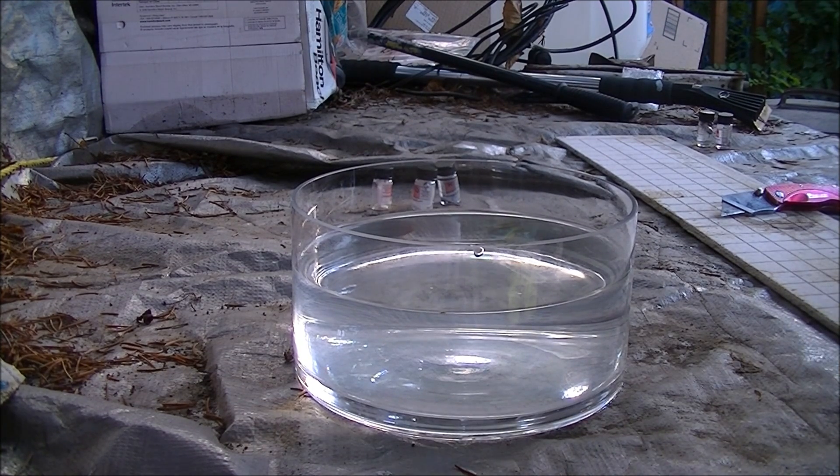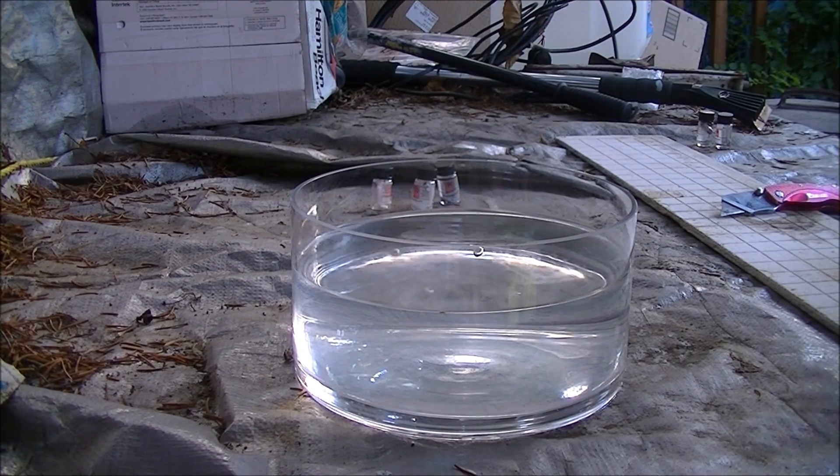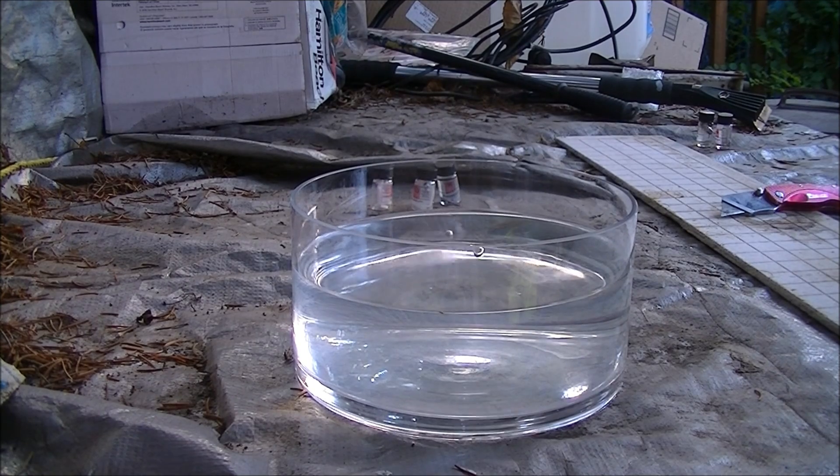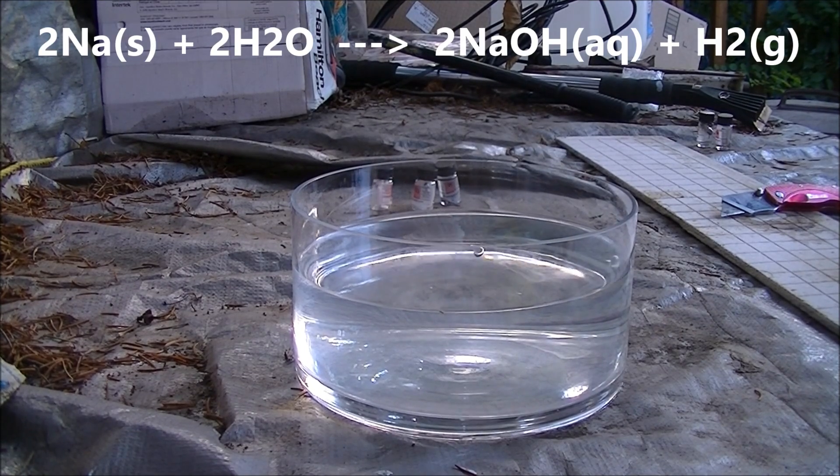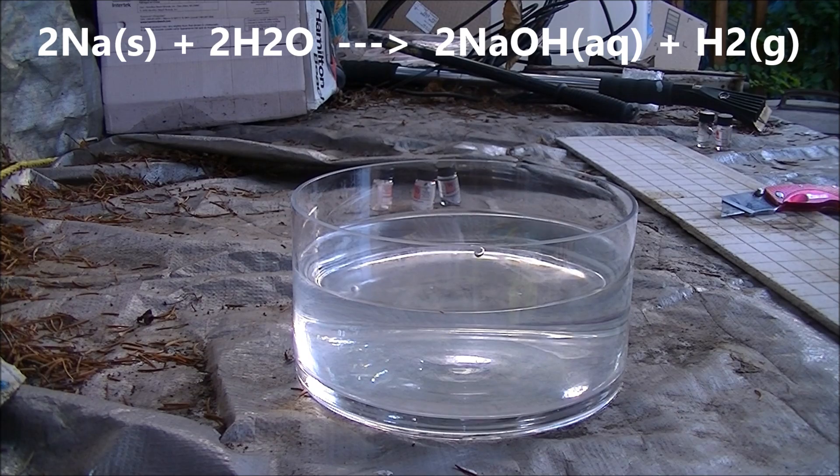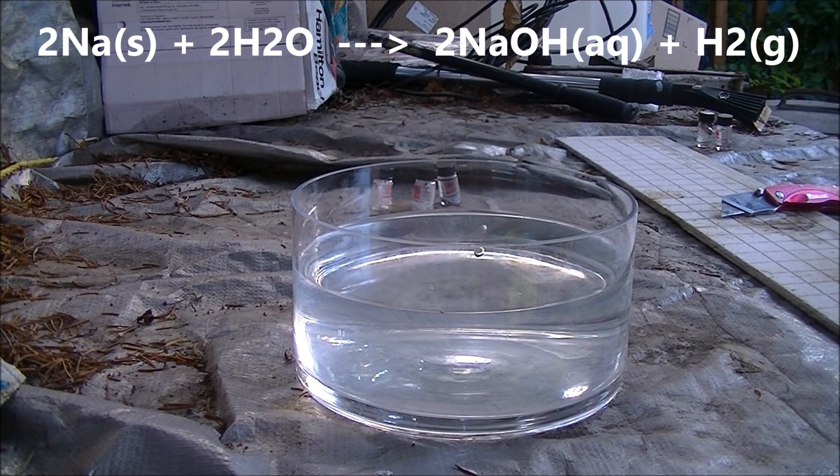The next one is sodium. You can tell the reaction is quite a bit more impressive this time.